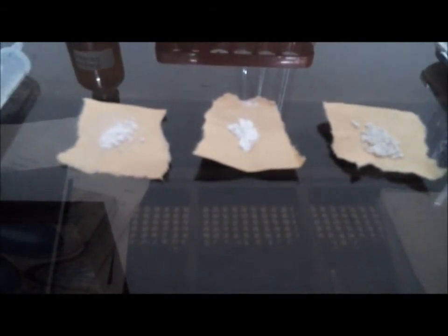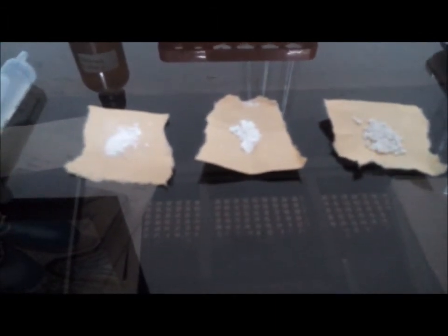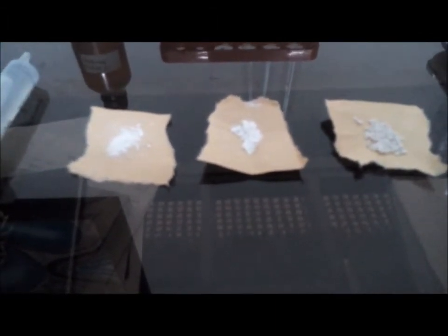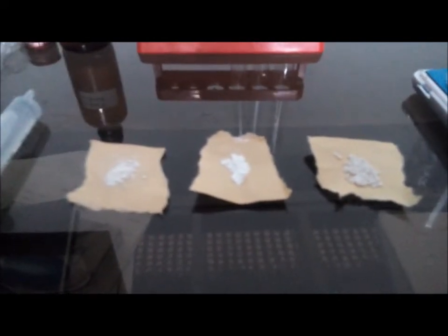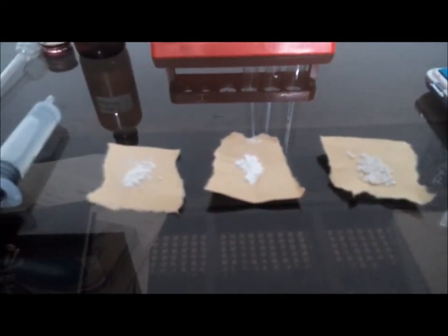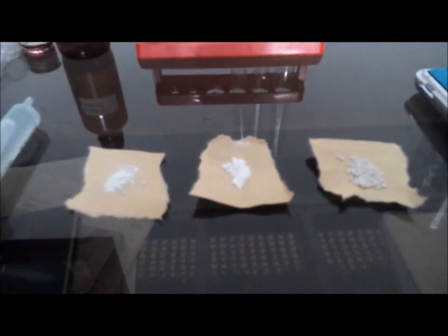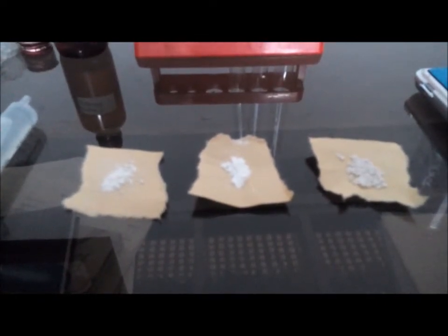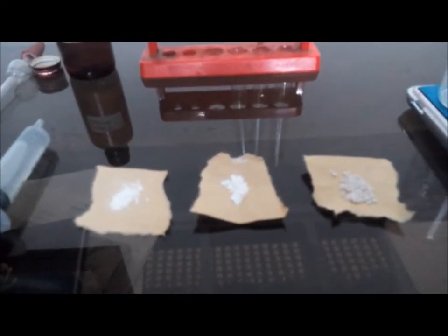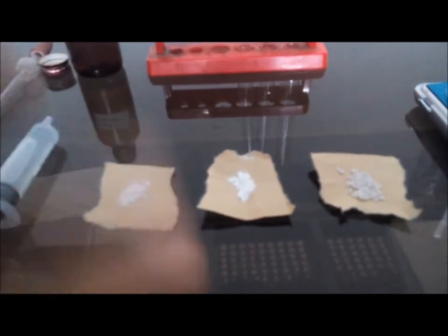So I'm going to compare these three starches today in terms of their amylose content. Now starch, as you may know, contains amylose and amylopectin. The iodine test, which is used to test for starch, is actually a test for amylose. So I'll use this principle in this experiment to estimate which of the three starches will have the highest amylose content.